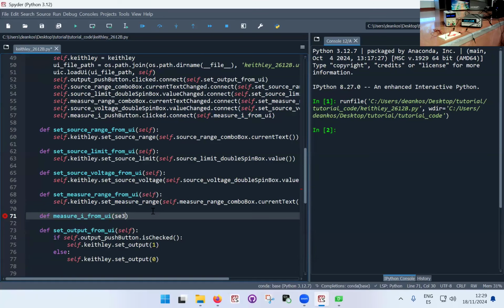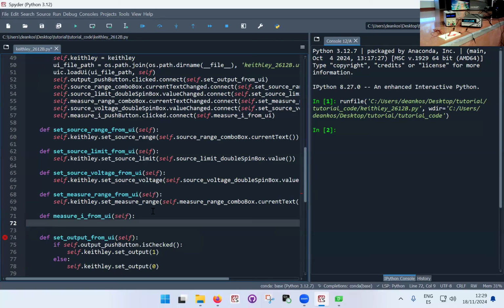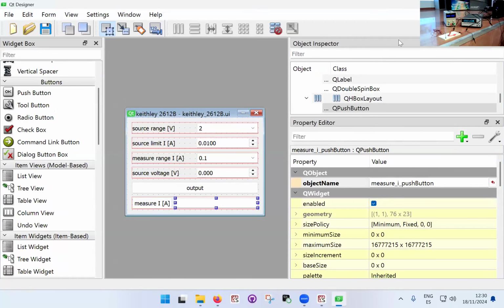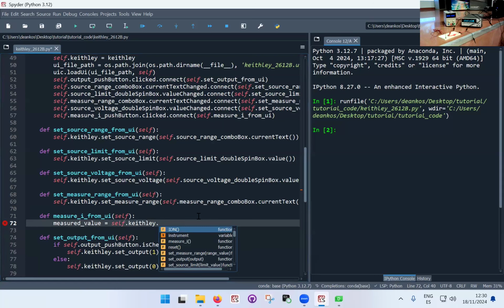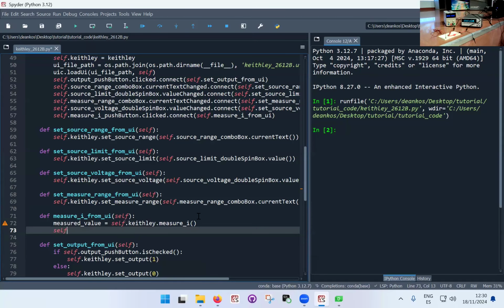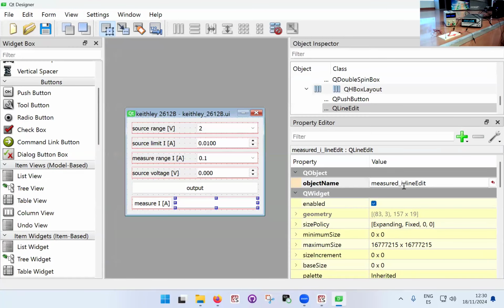Measure I from UI, self. Now, what's this function got to do? It's got to measure, it's going to ask the Keithley for a value, and then we have to put that value in that other box that we have in the interface, which is this one. Okay, so first of all, we're going to measure the value first. So we're going to call the measured value. It's a local variable that we're going to create, self.Keithley dot measure, right? And then we're going to put self dot the box that we've got here.